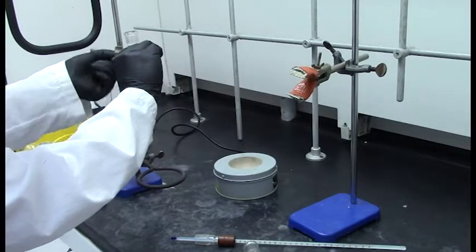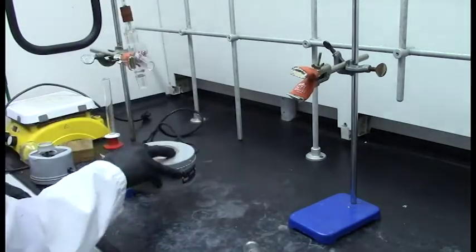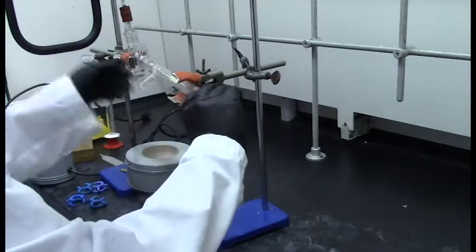Once all the joints are greased, start assembling the apparatus. You can adjust the height of the clamps for each glass piece as needed.